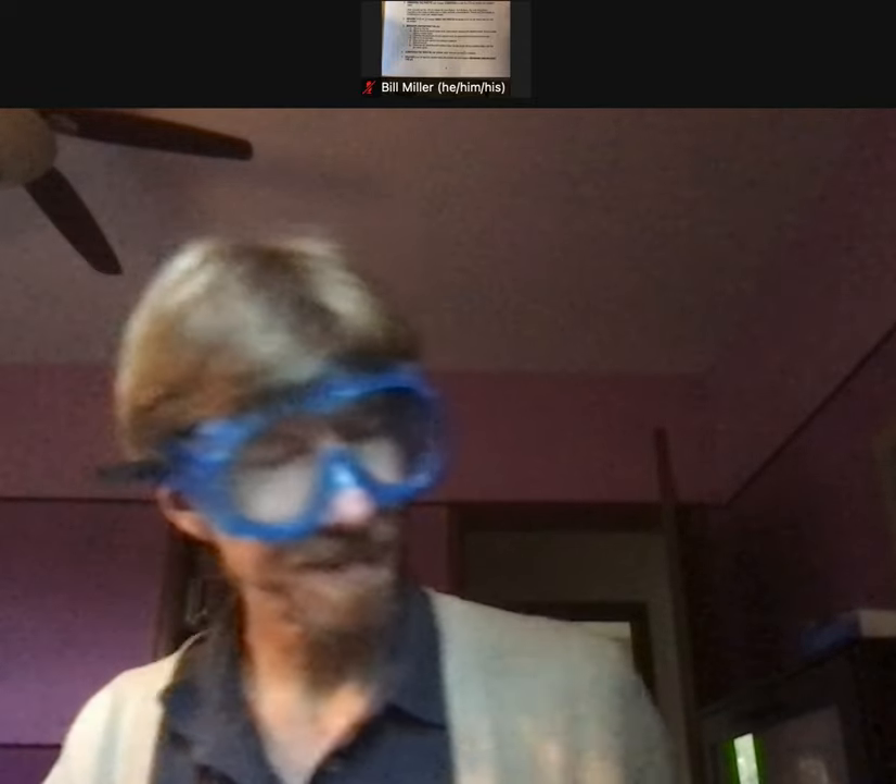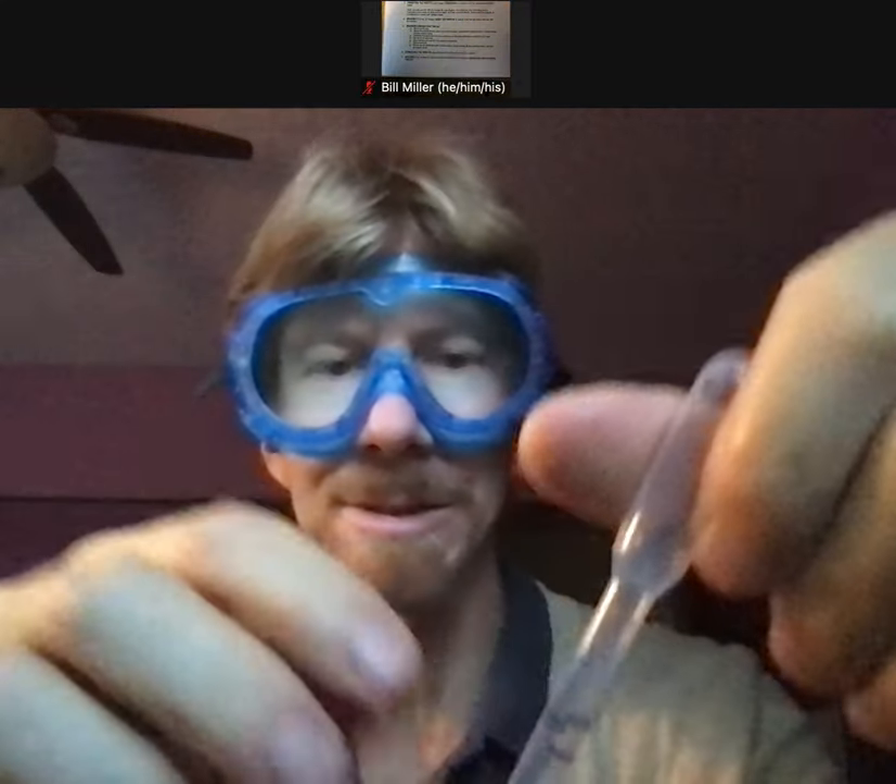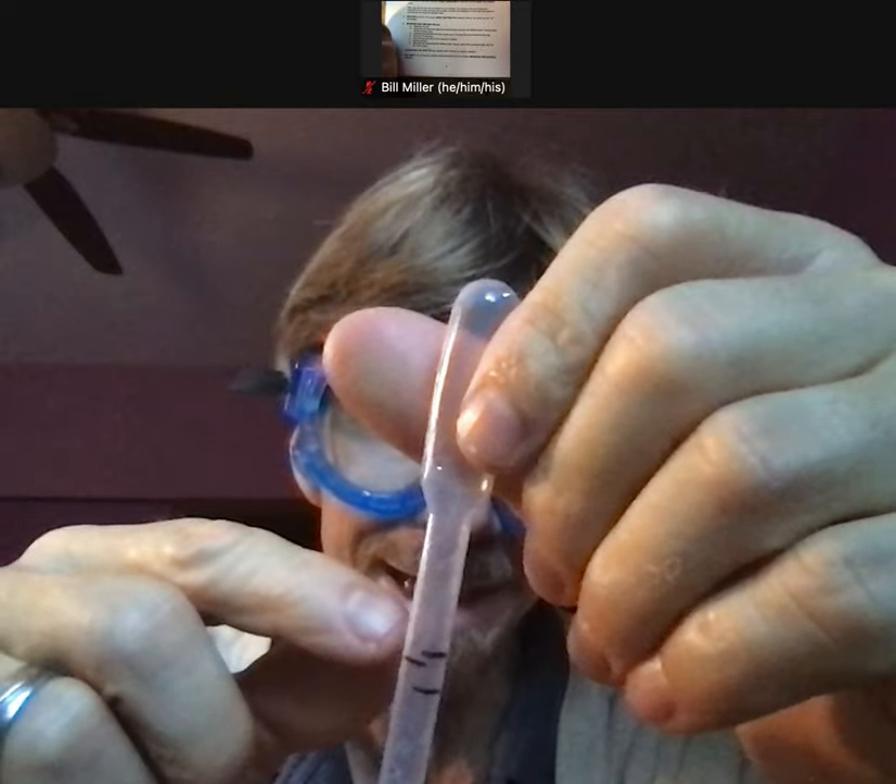The solution in here is the same as the solution here. Deliver 20 milliliters of vinegar using the pipette to deliver two milliliters ten times. Here's my 100 milliliter beaker — it's clean and dry, but it doesn't have to be. All that matters is it must not have any acid or base in it; it can have water. I'm going to do this ten times. My line is this one to the side — not the other two.